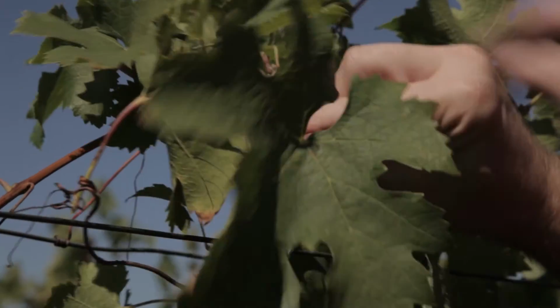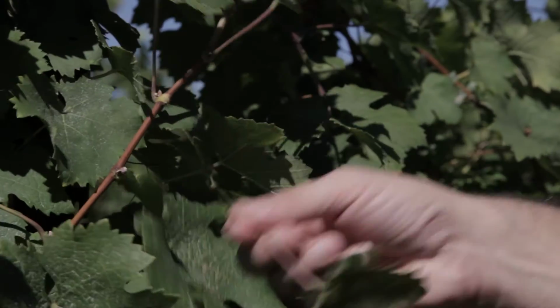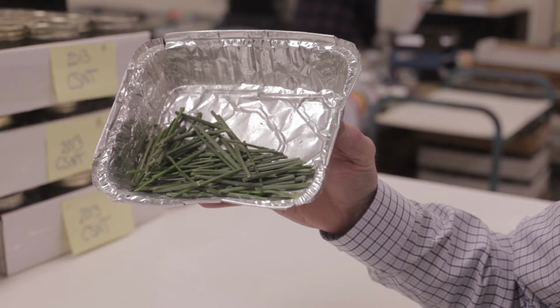The first step of the process is gathering a representative sample. Getting a good sample is the critical part of the whole analysis. One thing we look for is we want it to be representative, and it needs to be large enough for us to actually analyze. Some people feel if they send us 5 to 8 petioles, that's going to be enough.